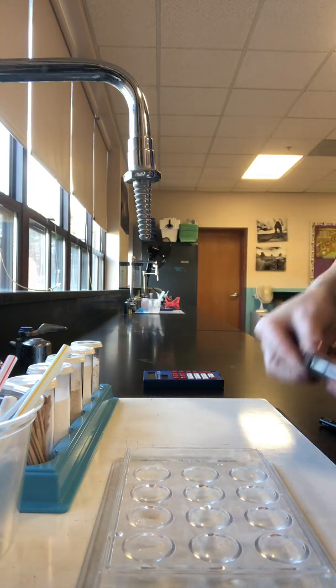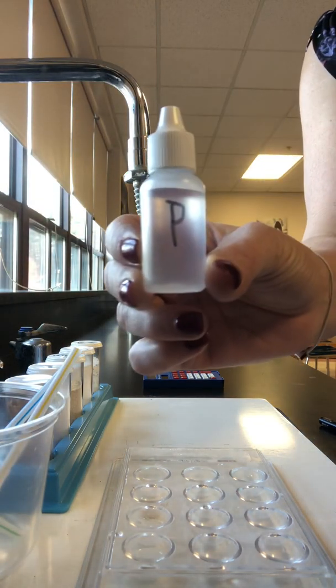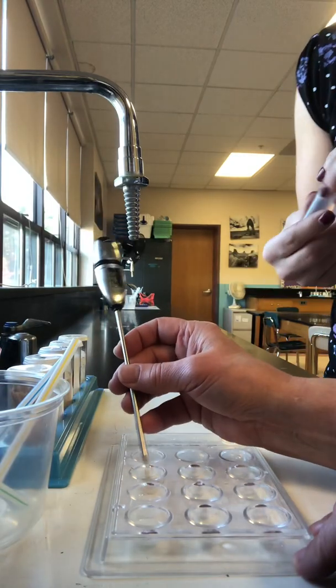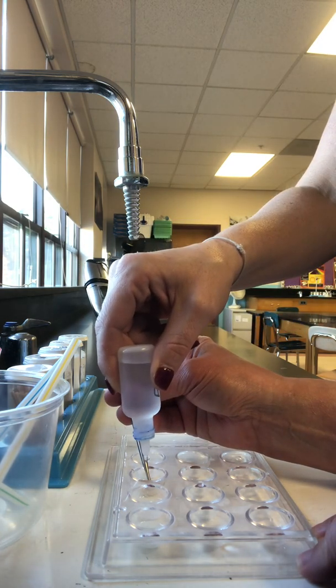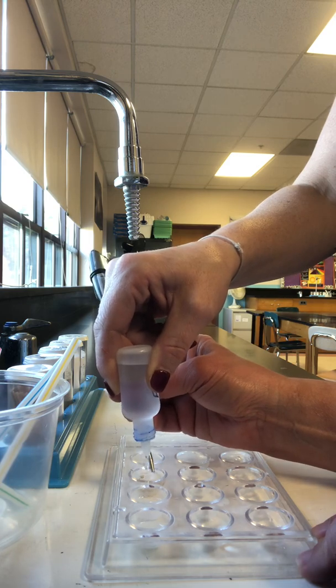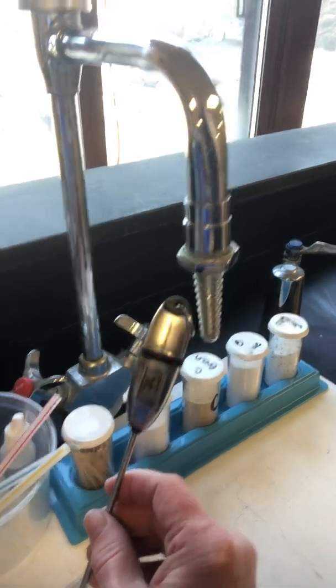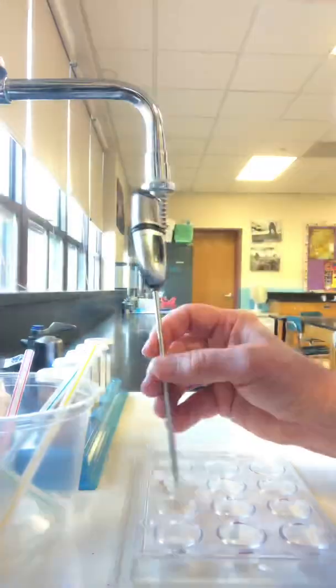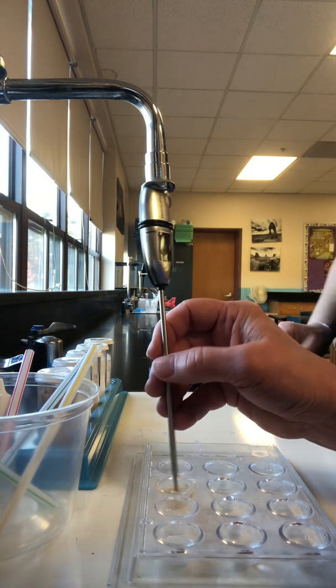Number 3. We're going to use peroxide this time. 10 drops of peroxide. Starting temperature looks like about 23.1. 23.1 to start. Okay. 1, 2, 3, 4, 5, 6, 7, 8, 9, 10. Get that nice and mixed. And we are climbing. We're already at 34, 35. 36. 36.1, I think I saw. And it bubbled up, and now it's starting to chunk up, solidify. Yep. It forms a solid.